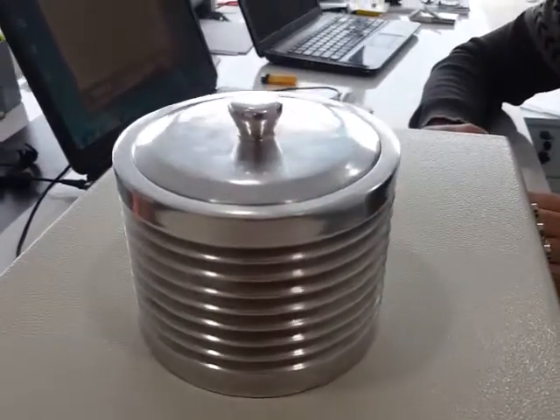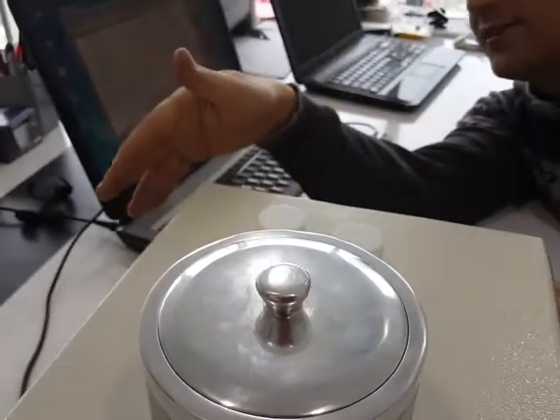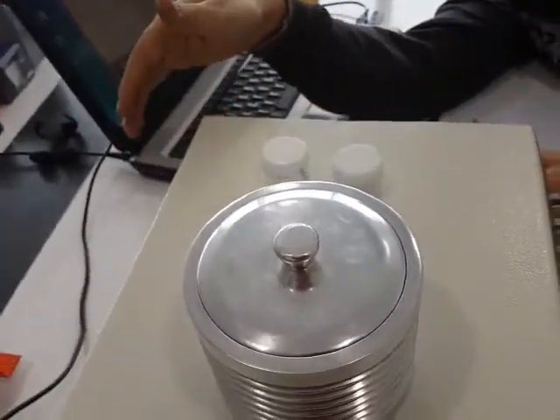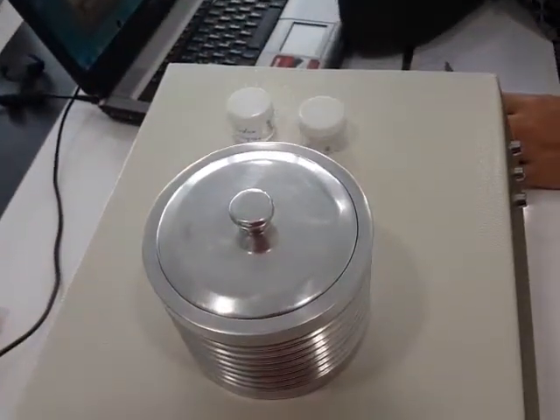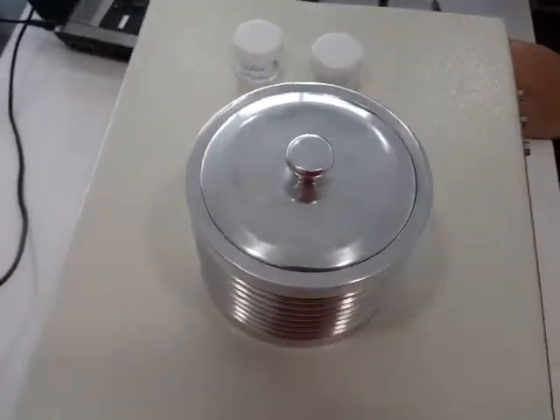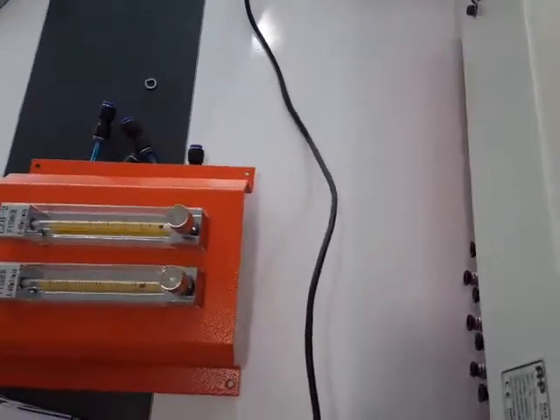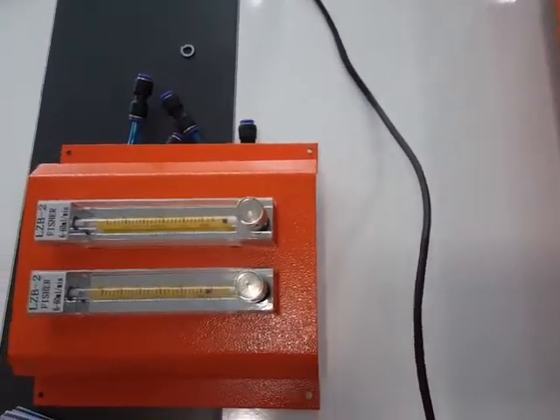Using a cigarette, the operator can easily check if the hosing and internal hosing of the machine has any leakage of the nitrogen and oxygen to the chamber. I mean, the nitrogen and oxygen are coming to the chamber correctly.